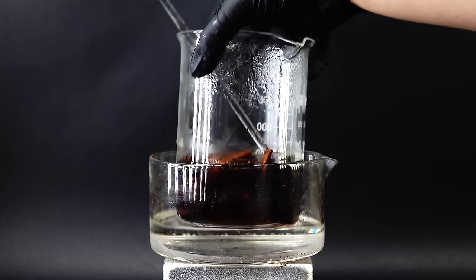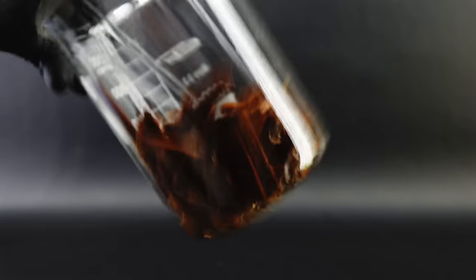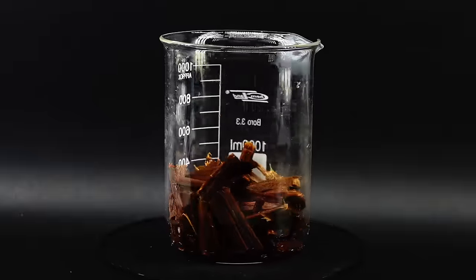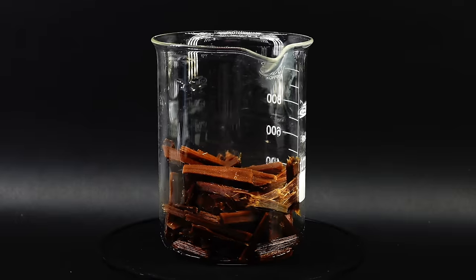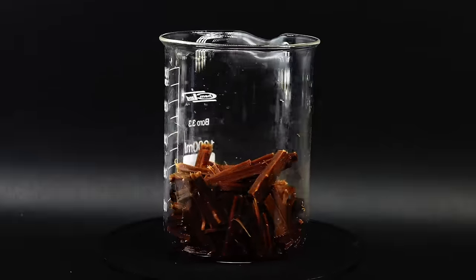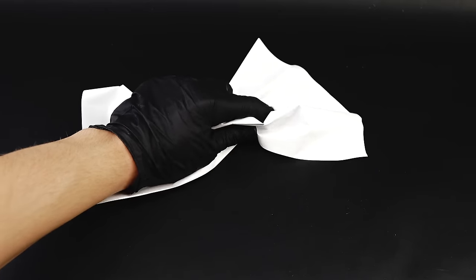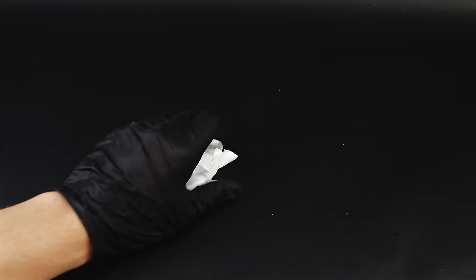To proceed, I got the beaker out of the water bath and got rid of the drain cleaner tea, which left me with some dark softened wood. It should now contain almost no lignin, but it is still full of the dirty sodium hydroxide solution, and to remove it, I have to turn this wood into a pulp. This process will separate the individual cellulose fibers and allow for further processing. It also just so happens to be the exact same thing the paper industry uses to process their wood, and this means that in theory, I could make some homemade paper. For this video, however, I still have more than enough interesting things to showcase, so I will leave making paper for some other day.